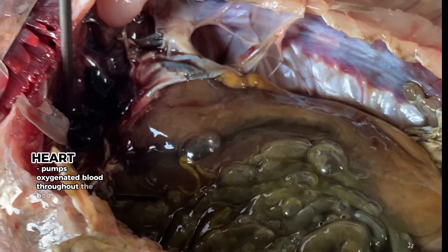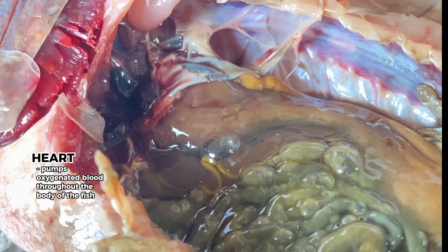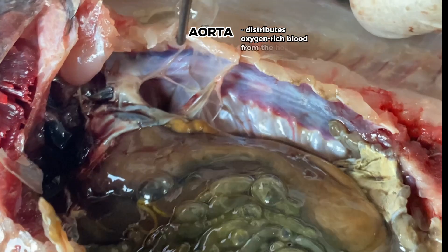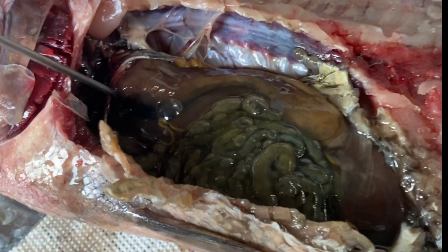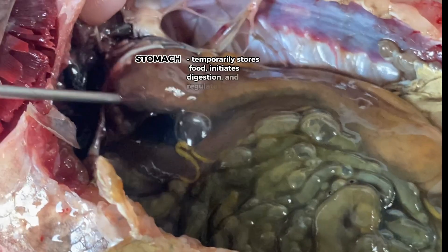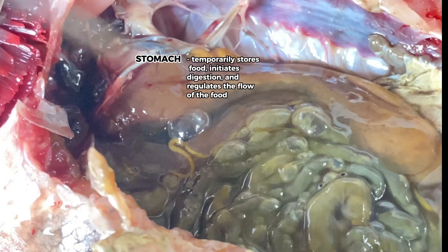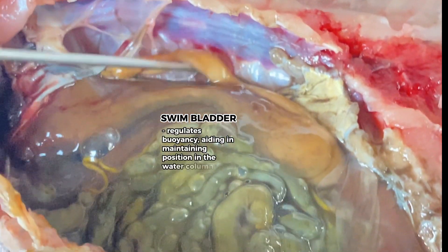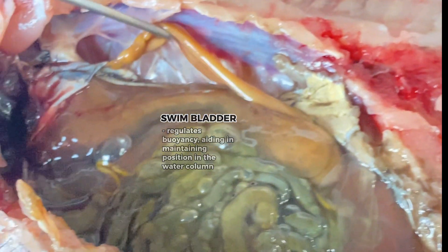Heart: it pumps oxygenated blood throughout the body of the fish. Aorta: it distributes oxygen-rich blood from the heart to the body. Stomach: it temporarily stores food, initiates digestion, and regulates the flow of food. Swim bladder: it regulates buoyancy, aiding in maintaining position in the water column.